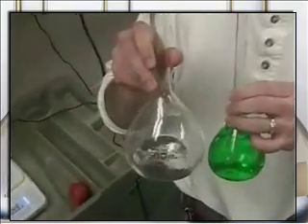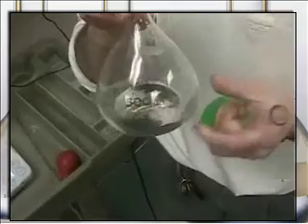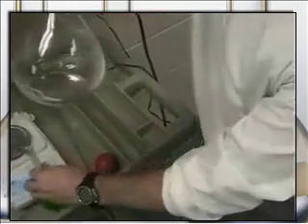And so notice I have a second volumetric flask, which is much, much bigger than the other one. And so what I'm going to do is fill this volumetric flask up to the line. There's just one line, the 500 milliliter line, but I need to now extract out of the dark green stuff a particular amount. Now, if you recall, we did the math on the screen, and the math on the screen says we needed 8.3 milliliters.